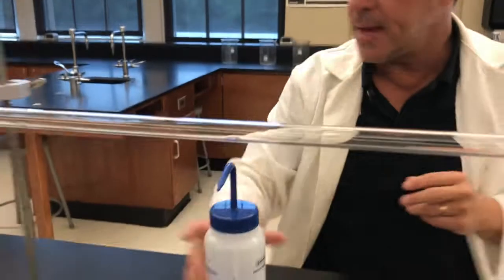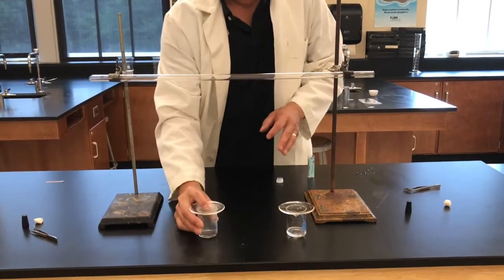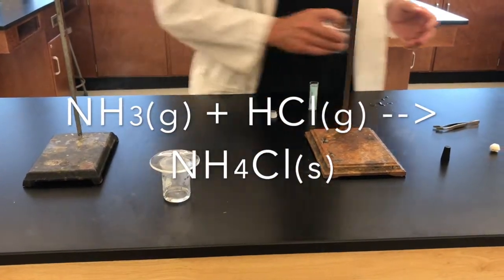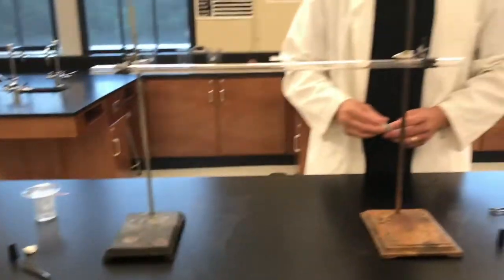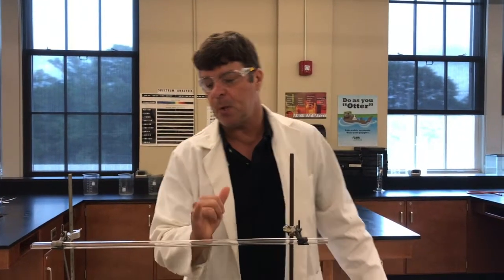Now the nice thing about what happens when these gases meet each other is that they form a white solid. You can see that white solid — that's ammonium chloride. So when ammonia reacts with hydrochloric acid, it forms a white solid. We'll be able to see a ring in here.